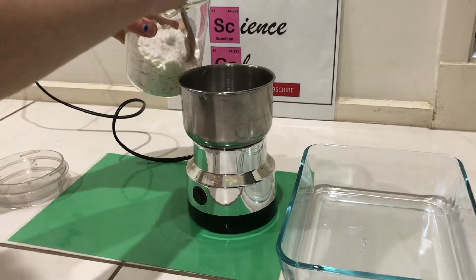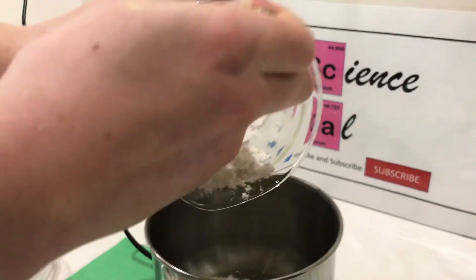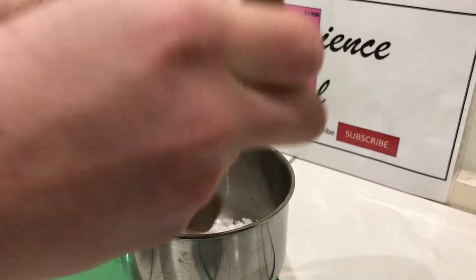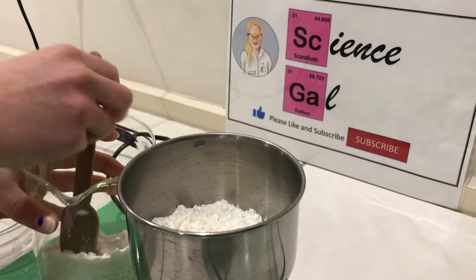Because there are a lot of chunks in the calcium acetate, I'm going to blend it so it is a fine powder. I am making it a fine powder, because then that way, when it dries in the oven, it will be easier, because it has a large surface area.